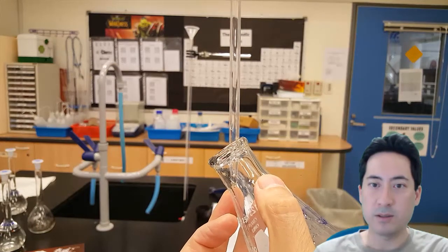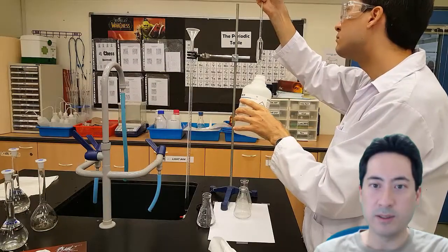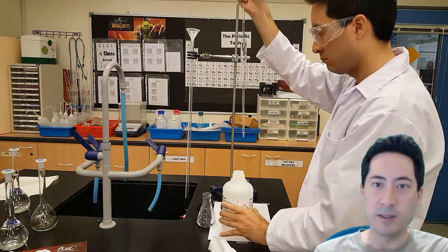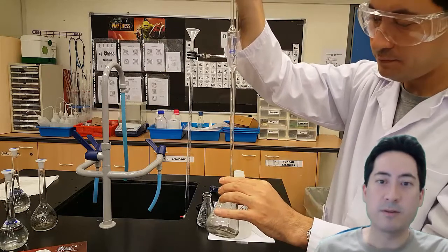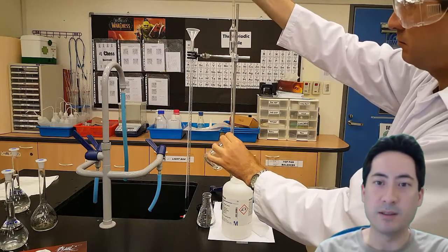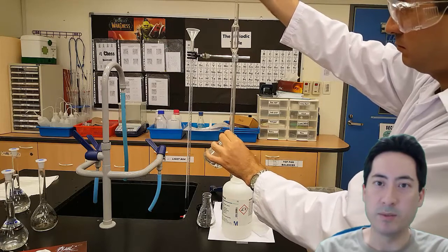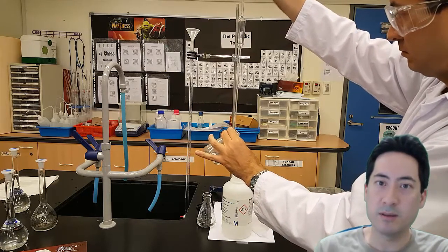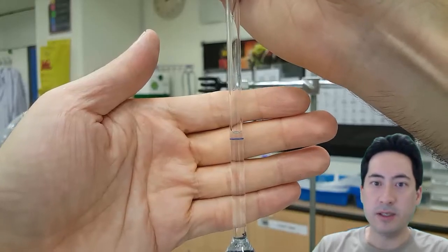And you only count to 3 seconds, 1, 2, 3 and you'll see there's a little tiny bit of liquid left in there and that's meant to be left in there. So the glassware is calibrated to that. So there is exactly 25 mils plus or minus the error on the glassware which is 0.03 mils plus or minus 0.03 mils and that's given to you on the glassware. And I basically just do that 3 times to get my conical flasks ready.